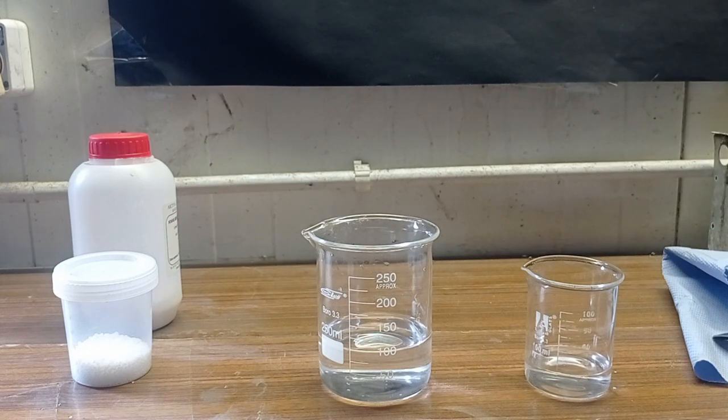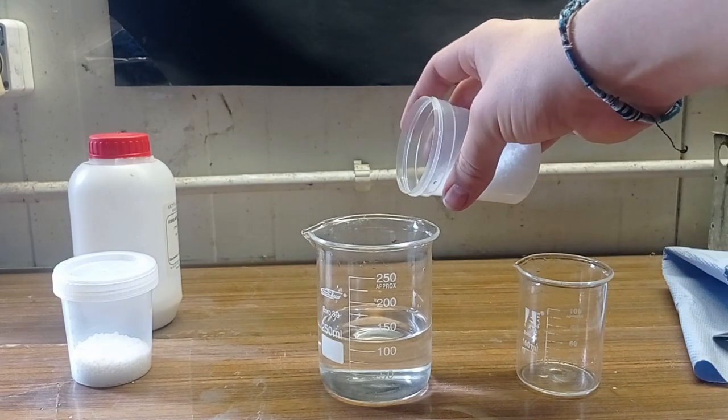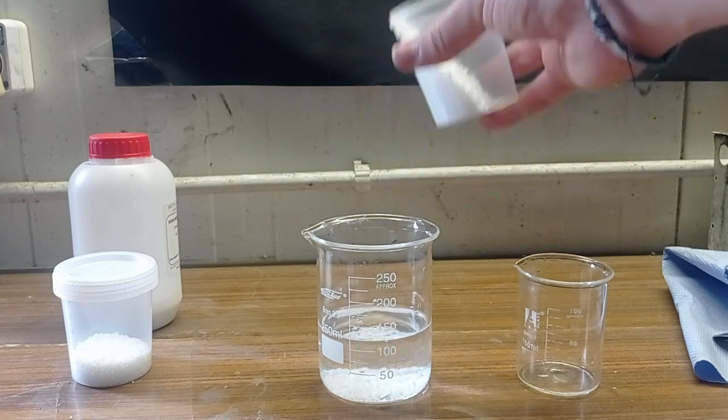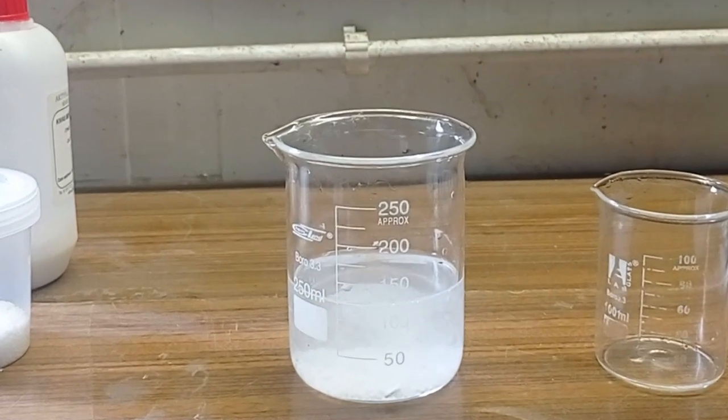Of course, you can use any source of sodium ions. You can use sodium carbonate, sodium bicarbonate, whatever. And now I'll slowly, in portions, add sodium hydroxide.